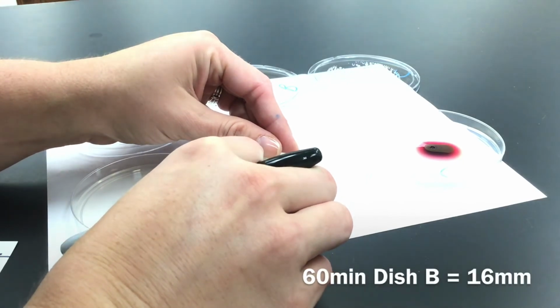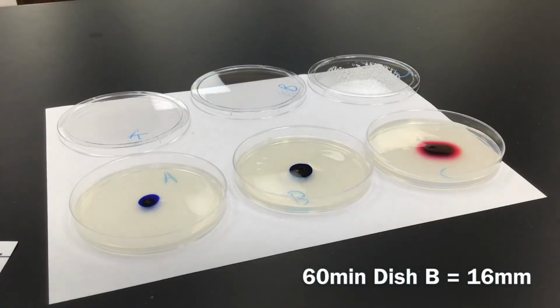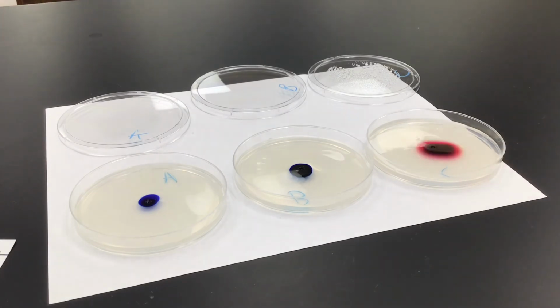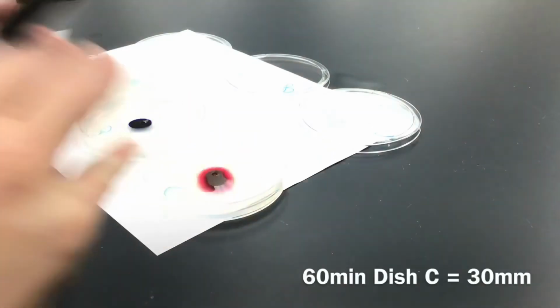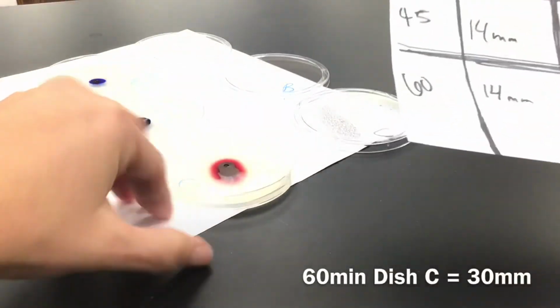And then B is still at 1.6, so 16 millimeters of 1% methylene blue. And then the final one, we're going to measure at, it's hard to see, let me move this. We're at 3, so 30 millimeters. Those are our final numbers for the potassium permanganate.